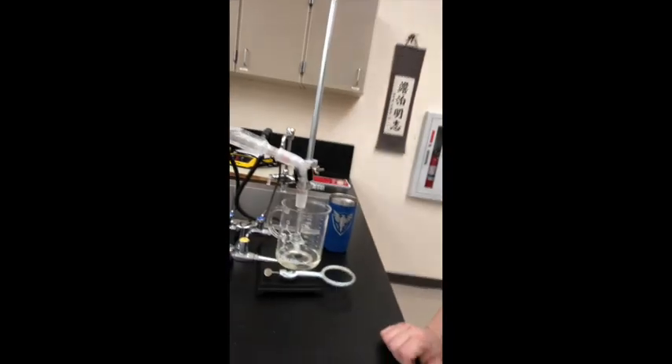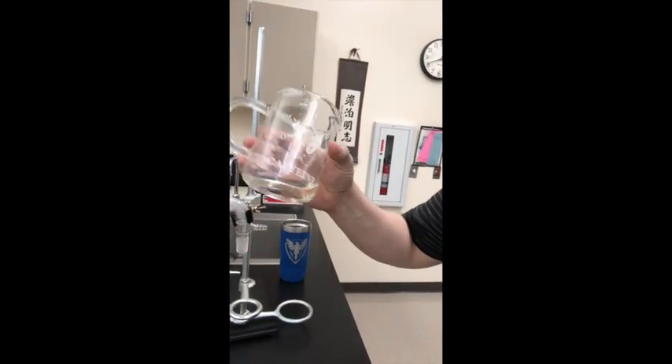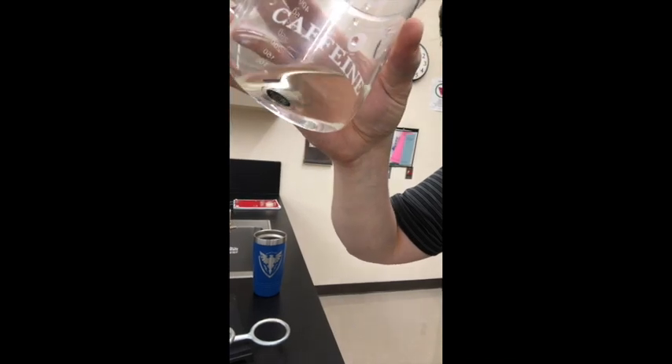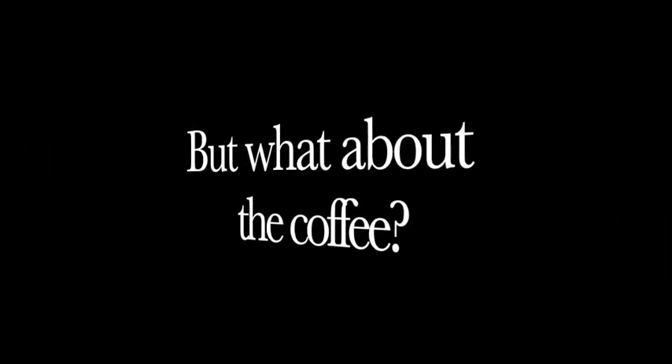Back. It's been about 45 minutes since the last time I recorded this — which means everything's been cooling. You can tell it's off, there's no burner. This is no longer hot — it was surprisingly hot before, but now it's not. Pretty clear. Tiny, tiny bit of not-clear from that one point where I had a bubble up into the condenser. But for the most part, it's water. Tastes a little bit like coffee — not really though. It's pretty clear. It might just be from the cup — that's what I usually drink out of this cup, that's why it says caffeine on it. Anyways — cool. The power of science.